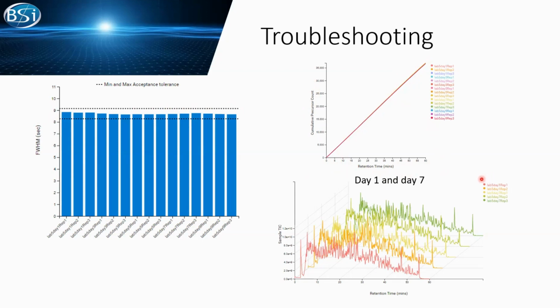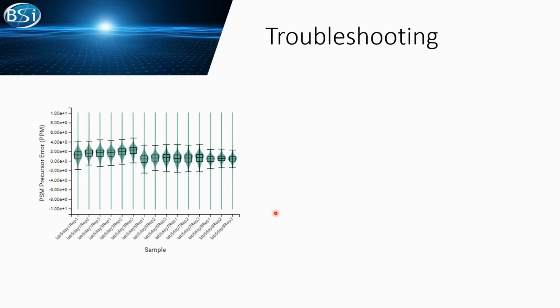We also put the TIC chromatogram between day 1 and day 7. We list them here and just give a comparative view. But up to here, we are not seeing anything bizarre. All right, that didn't answer our question. So could it be something else? We can take a look at other data.